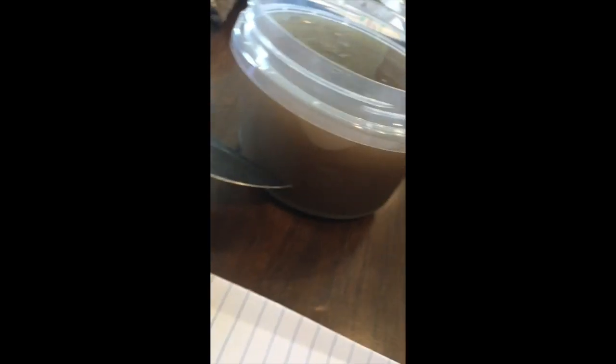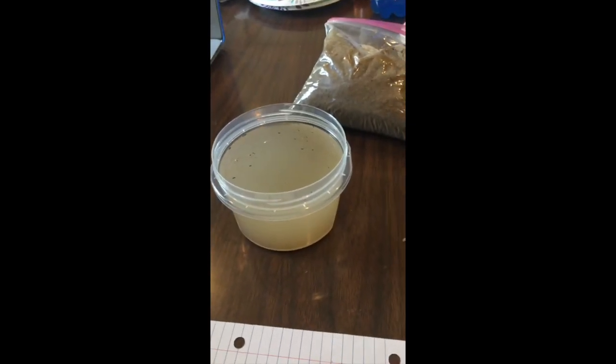And then on the forest soil, it's pretty dark, kind of like a milk chocolatey color. I definitely wouldn't drink it. You can tell it right about here. My lighting's not the best, and neither is the camera, but right about in that area is where a lot of it settled to, which settled down significantly because it was a lot murkier on both of them. Next I'm going to let out some of the water and compare the samples again.